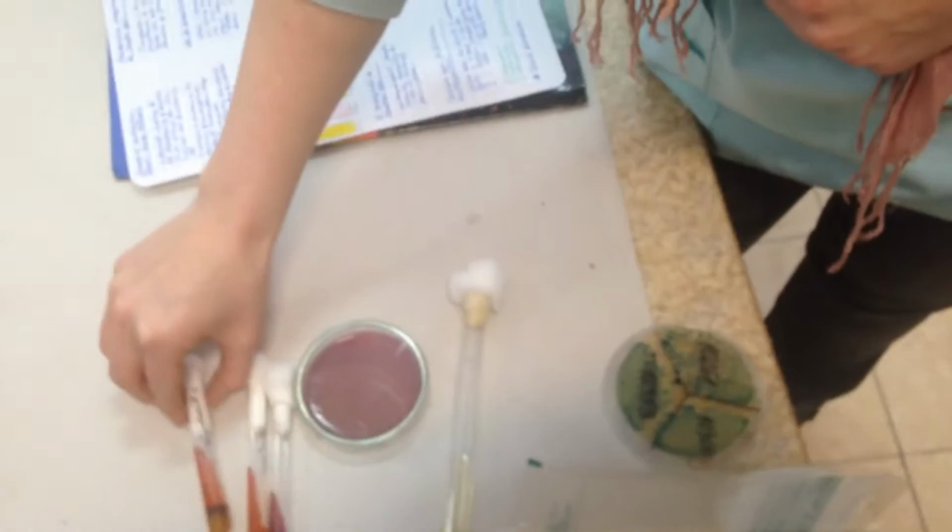That's a Kligler for E. coli. It is a fermenter of glucose and lactose. It's yellow, with gas and yellow. Negative reactions otherwise. And we have Salmonella species, which is first of all distinguished by the black ring of H2S. It was positive for glucose fermentation, but negative for lactose. This is why the upper part is purple or pink.